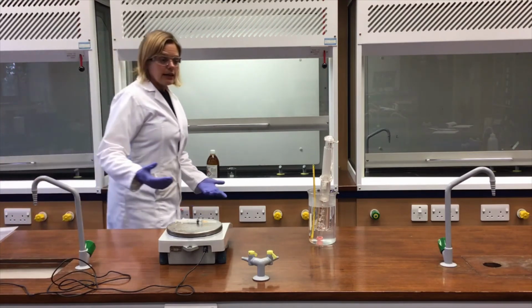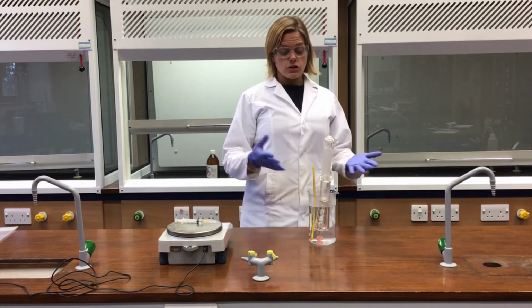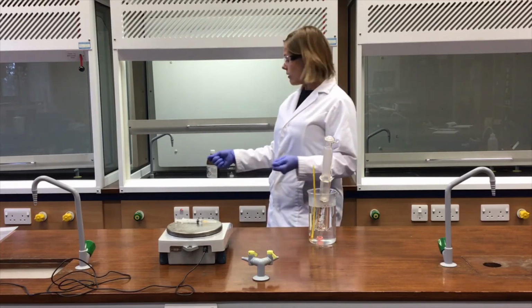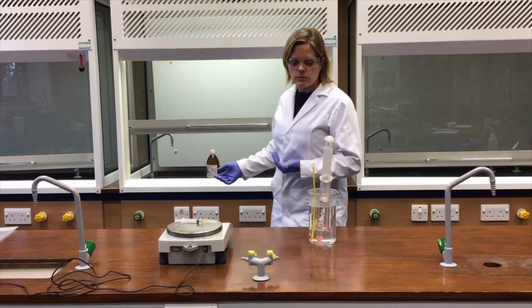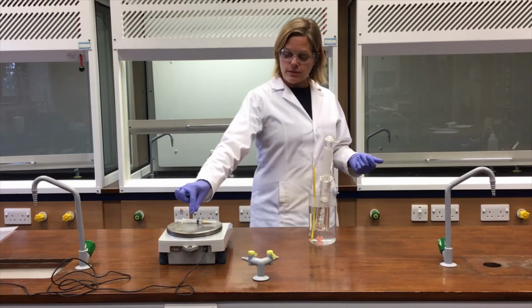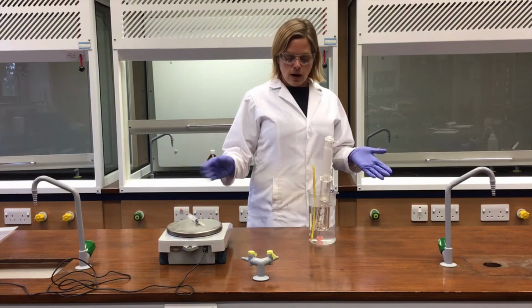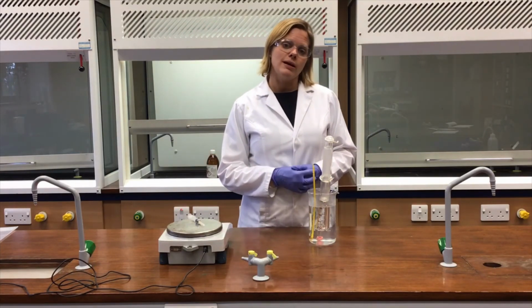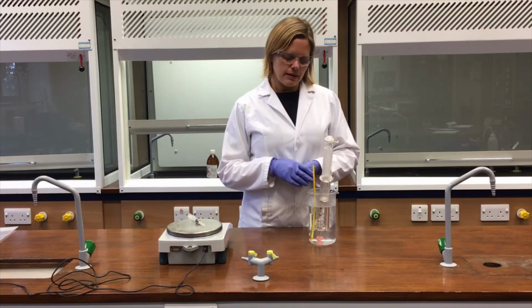Now, ideally, then what I would do is repeat that measurement several times. So to do that, go back to the fume cupboard with the gas syringe and the barrel, empty it out by flushing it into the fume cupboard with the fans running, which is the safest way to dispose of that really tiny quantity of the hexane there. Similarly with this, I need to dispose of that carefully into the fume cupboard as well. And just repeat that process and see how close the different values of the Mr might be.